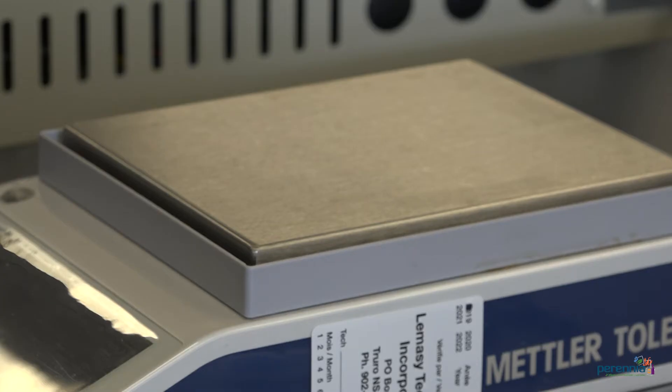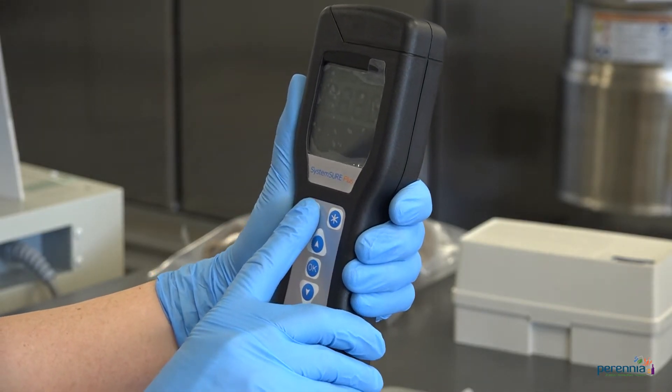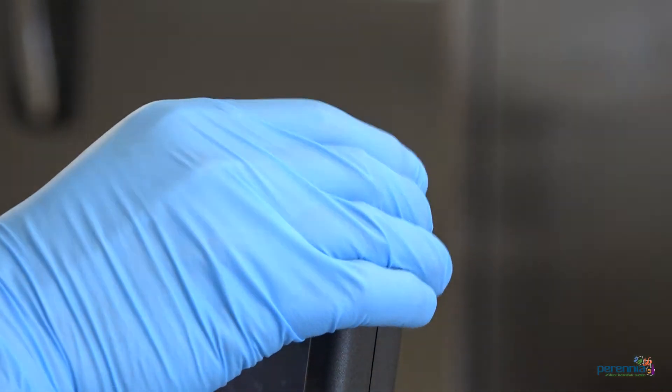First we will show you the steps on how to swab a large piece of equipment. Step one, turn on the device. Step two, calibrate the device.